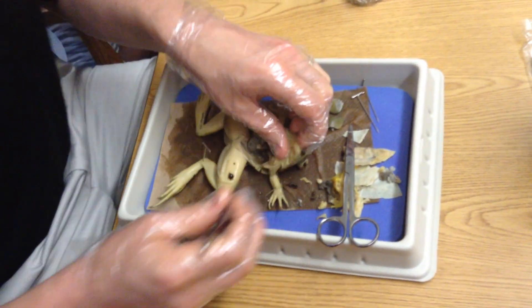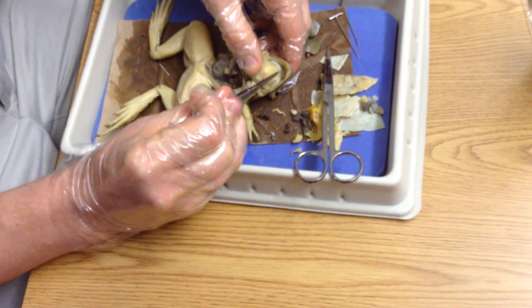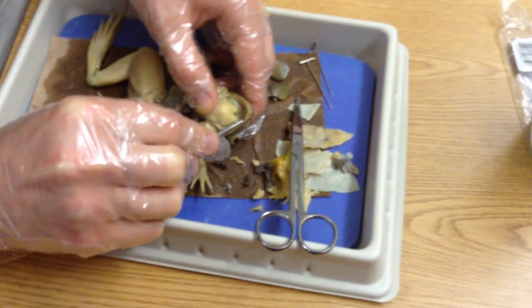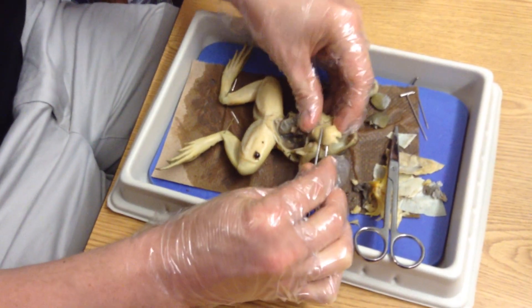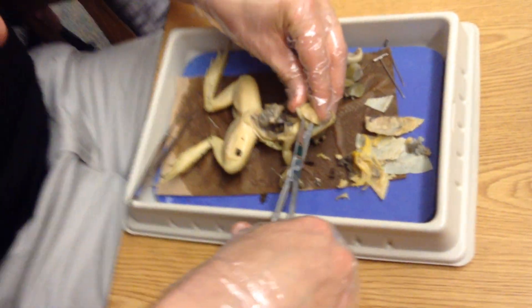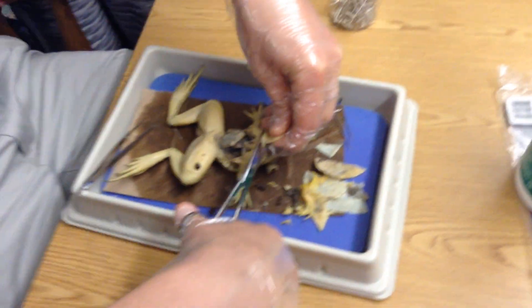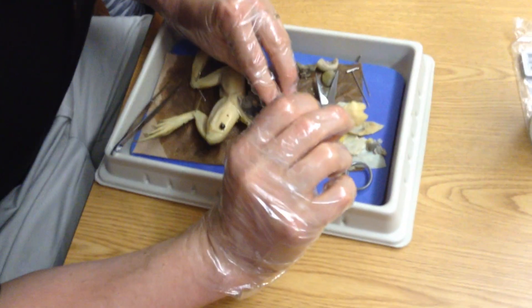The other thing we talked about was the tongue. Right in here — if you're on this side, you can see pretty well. You see the little vomerine teeth right there? The two little dots right at the top? You'll see them when you guys look tomorrow if you can't see them from there — they're two little almost whitish dots. I can feel it on the inside ridge right up here with the tweezers, kind of like sandpaper. This thing right here is the tongue — it's really big, this whole thing is the tongue. It attaches on the underside here. It doesn't look long because it's kind of dead — otherwise it's very stretchy.